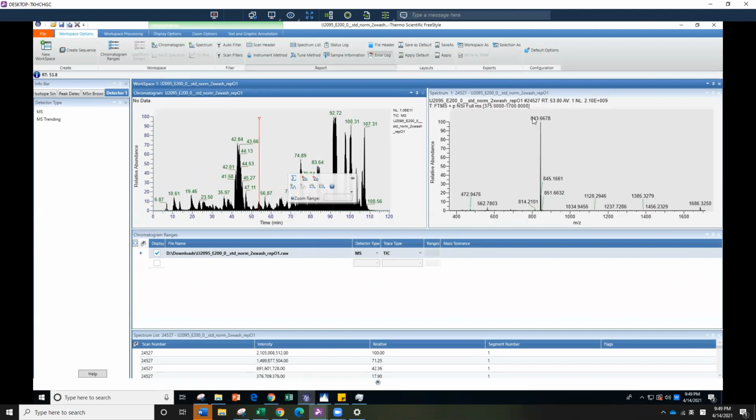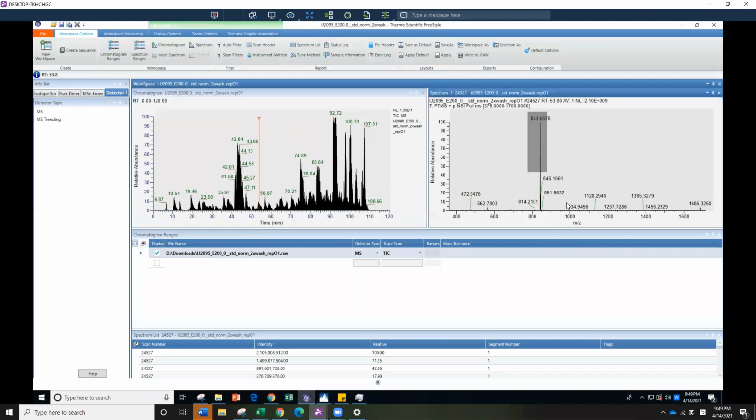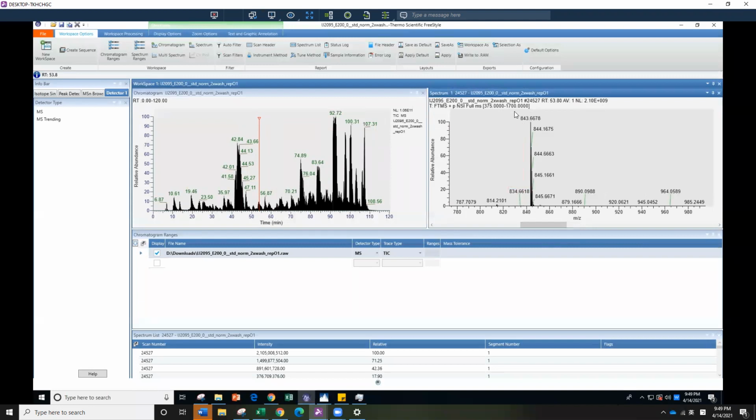This is one MS1 spectrum, and you can see it is at about 53 minutes, at this time. The signal of the MS1 is e to the 9, and this is m over z versus relative intensity. If you zoom in, you can see it is really abundant here. It tells you the m over z, and it looks like a pretty isotope envelope.